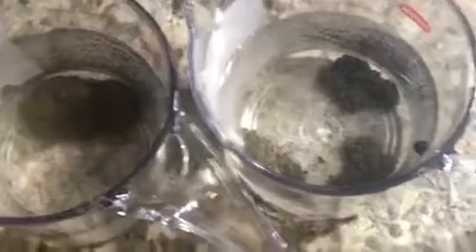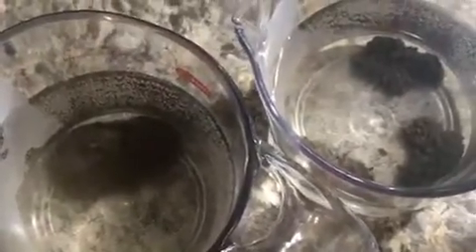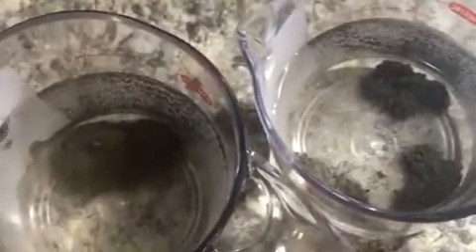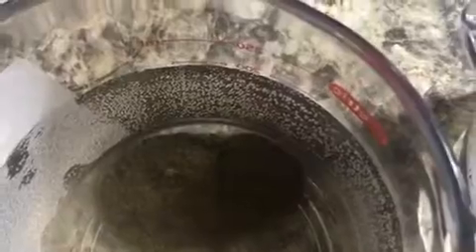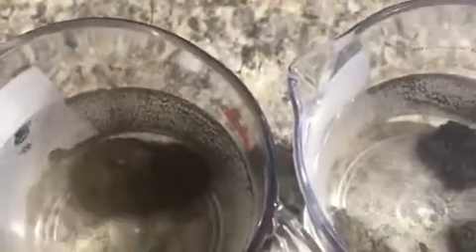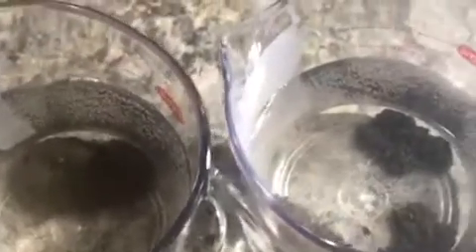20 hours later, we have our soil sample from the tilled field breaking down and coming together, basically showing that its structure will not be held with rainwater, so it's more prone to erosion.